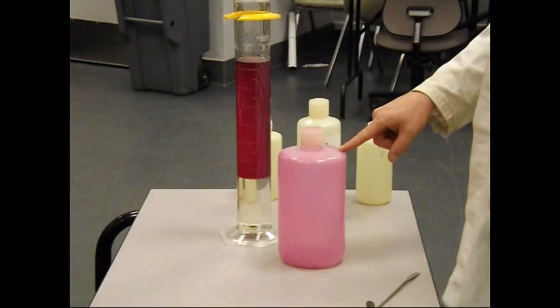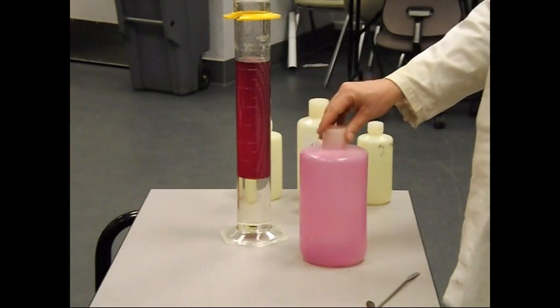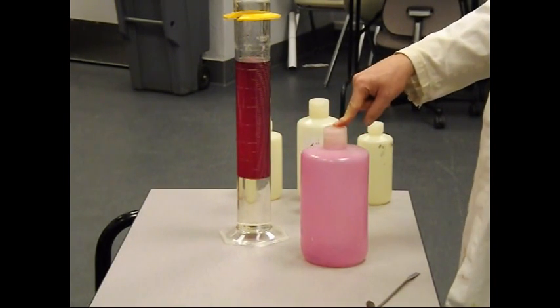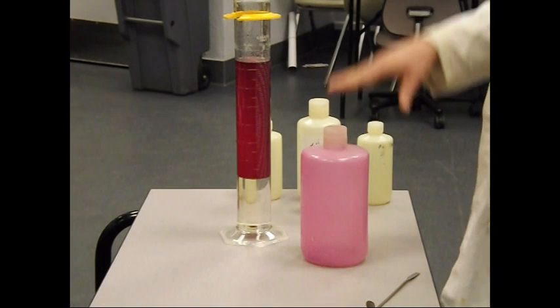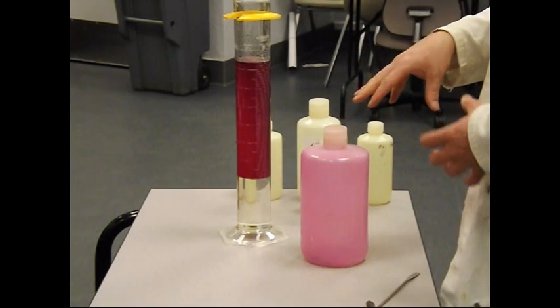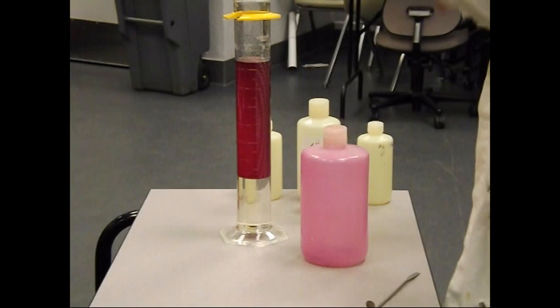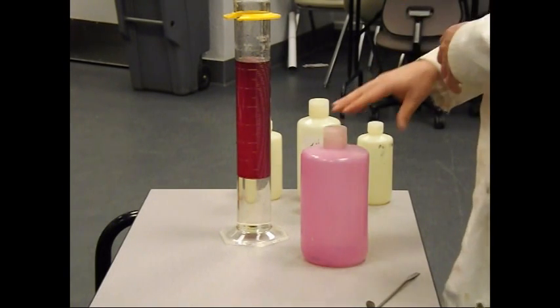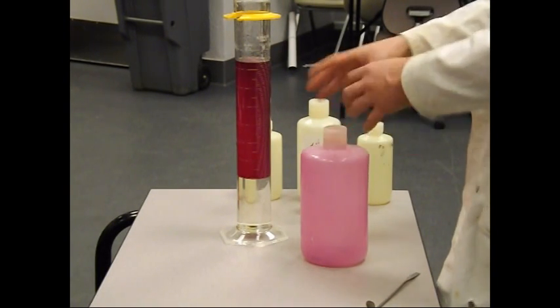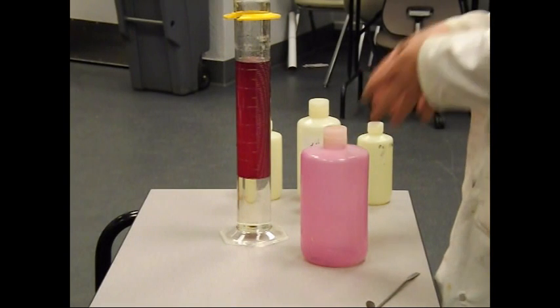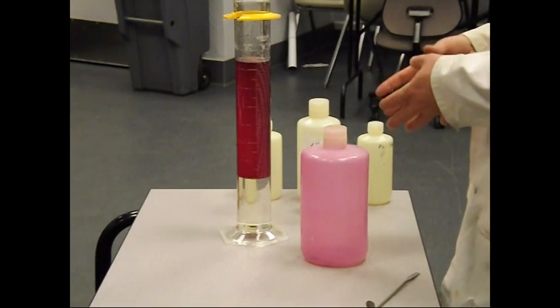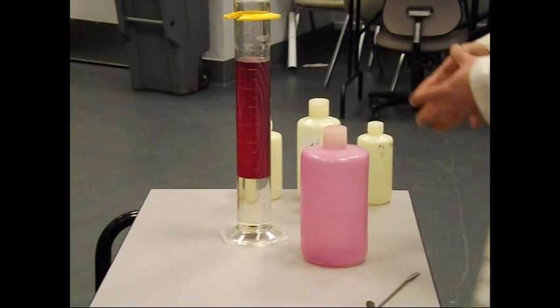You can also look at the bottle that I was working with here. And with regard to this bottle, it's also pink because even just the amount of time I put the solution in here, shake it up for a little bit, some of the iodine is now dissolving in the non-polar polyethylene bottle that I have, which is turning pinker and pinker as I do more of these demonstrations. So, there we go. Thank you.